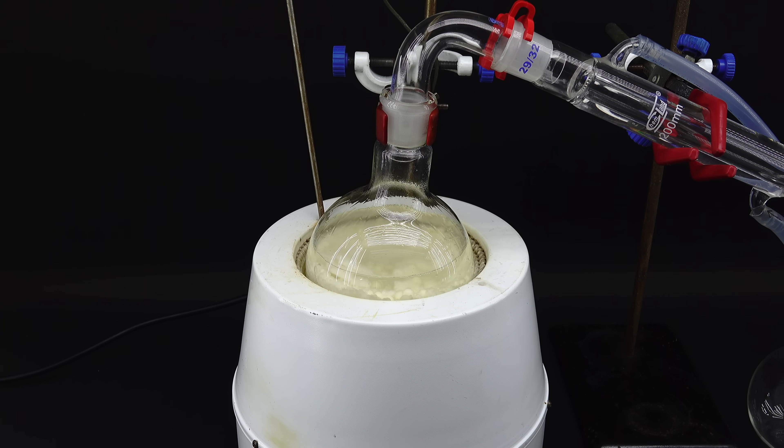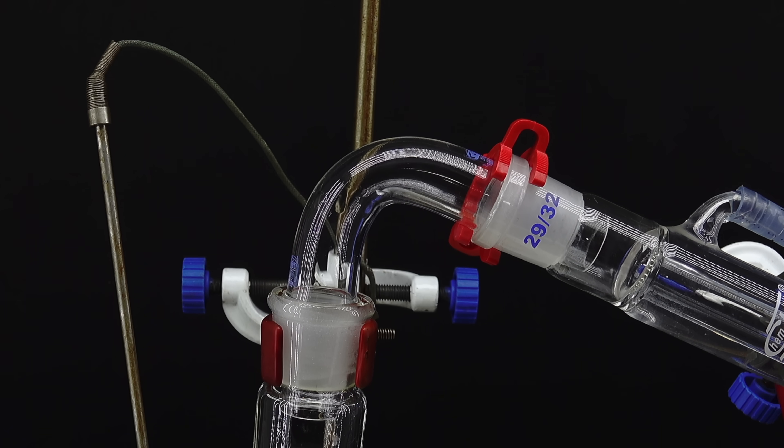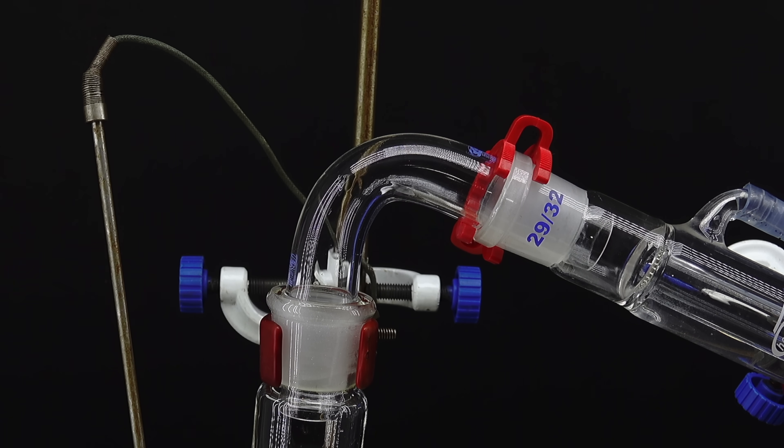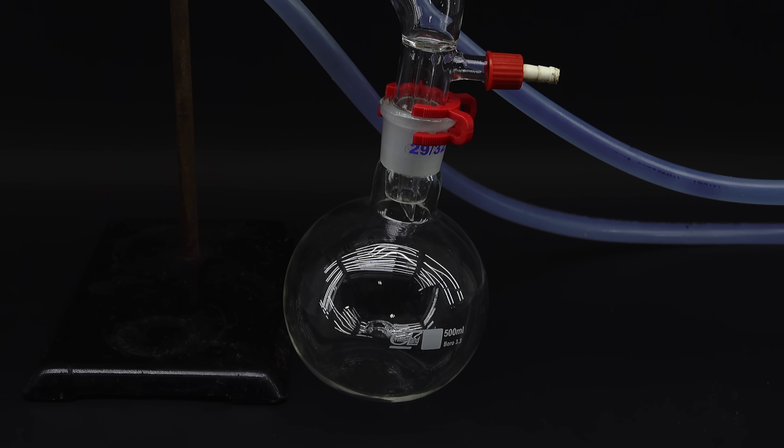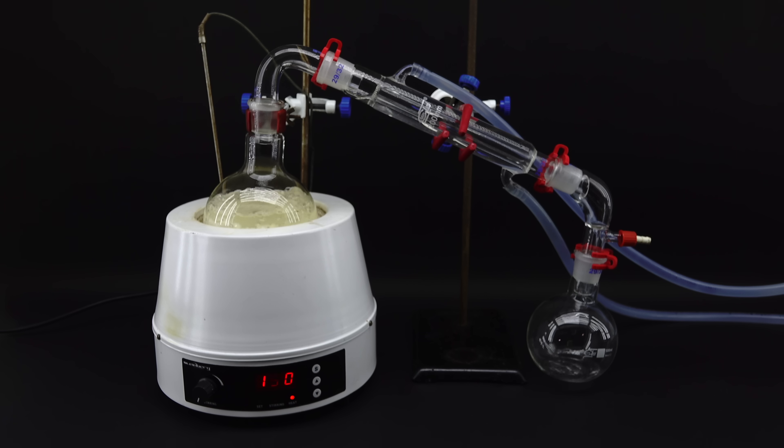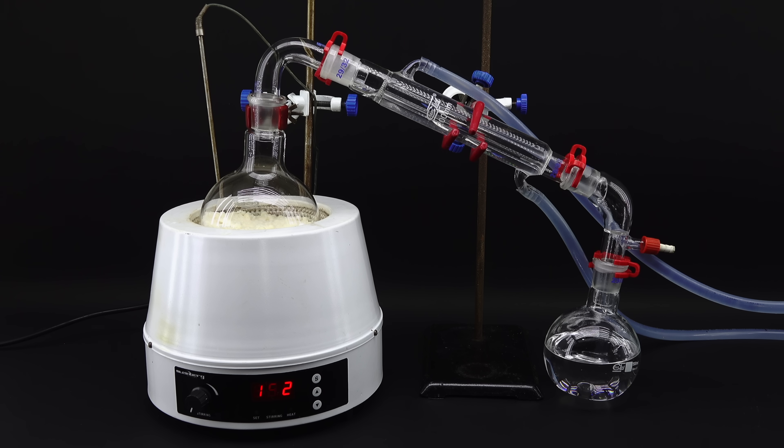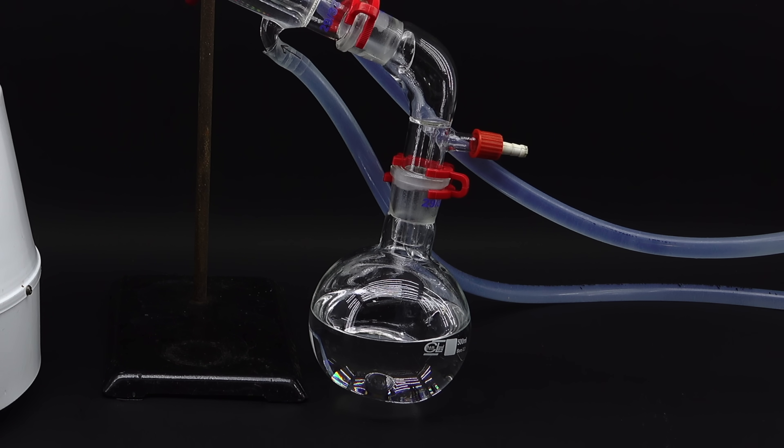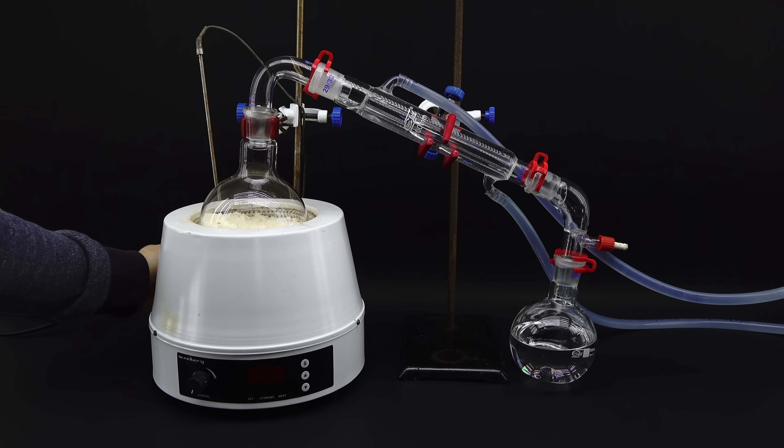It didn't take long for my reaction mixture to warm up and start letting off a bunch of alcohol vapor, which quickly traveled to the condenser, and after getting turned back into a liquid, dripped into a receiving flask. This is quite a handy way to purify liquids in general, and after only 3 hours, it looked like no more alcohol was coming over, so I stopped the distillation.